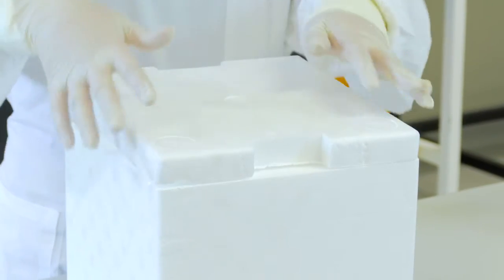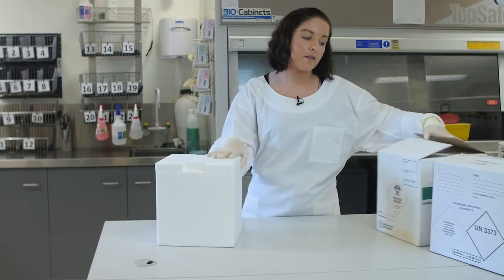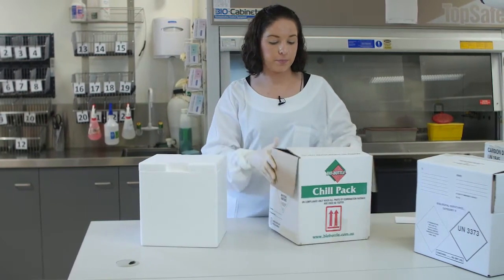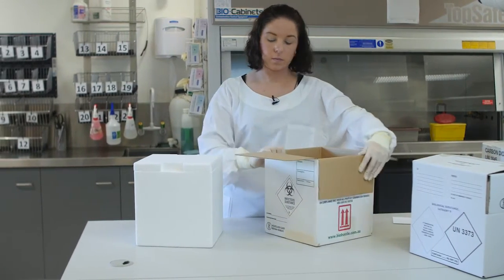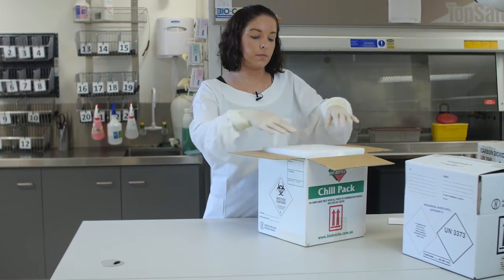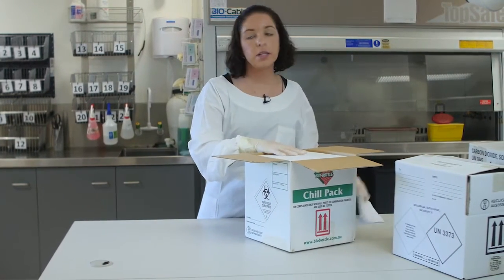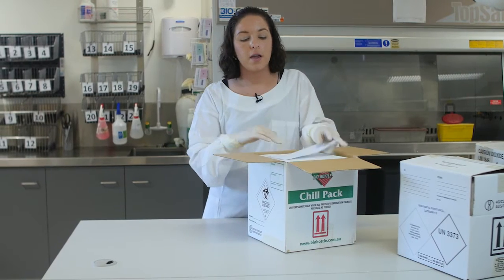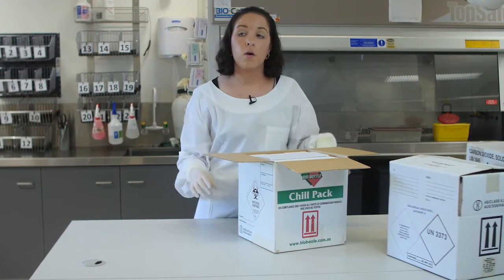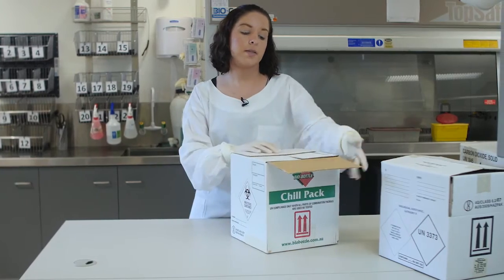Place a lid on your styrofoam box and transfer your styrofoam box to your outer packaging. At this point, you'll need to also include your SAS and the appropriate IATA documentation on top of the parcel, and seal your box.